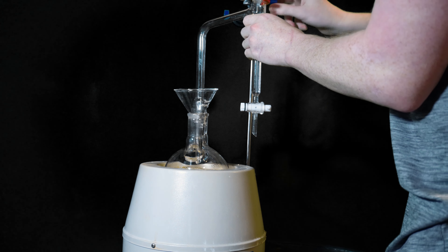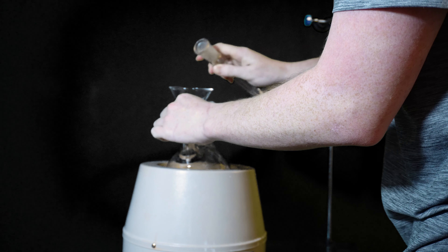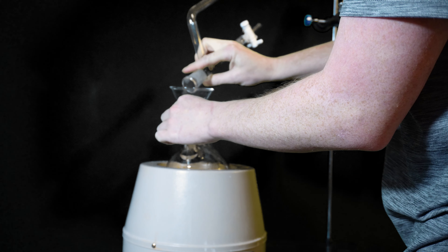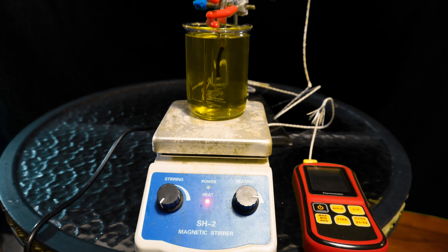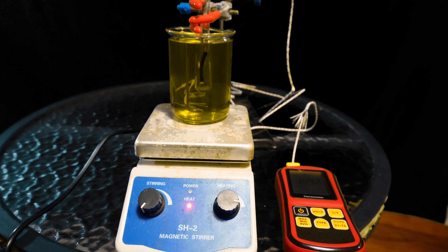It's best to do this in one stretch, and as soon as the water stops coming over, the reflux is done. I set up my ketal for distillation and tried a simple distillation first just to grab mostly toluene. I ended up adding a Vigreux column, which is actually really important on this step. I kept the first fraction for later because there's definitely ketal in it — the ketal smells really minty so it's easy to tell apart. After getting over mostly toluene I switched to vacuum, cut a first fraction off, and distilled over my ketal consistent with the literature. I got about 100 grams plus extra in the other fractions. I like to verify the ketal with a boiling point test — you're looking for ranges in the 150s.